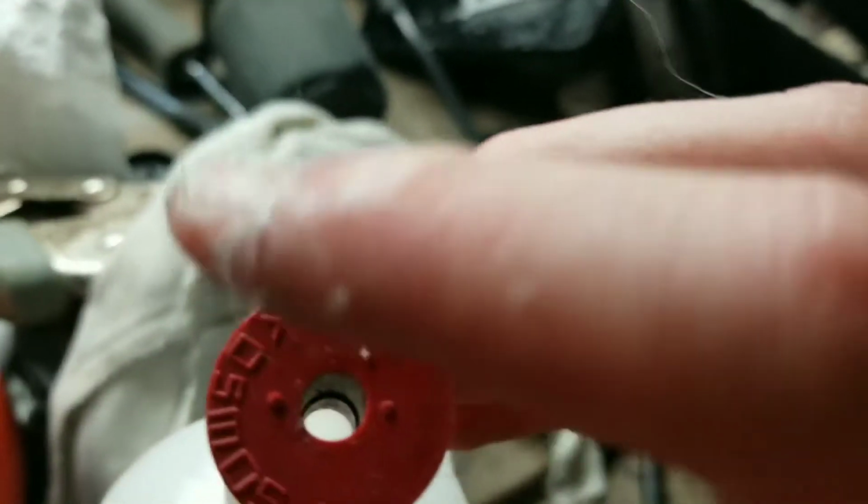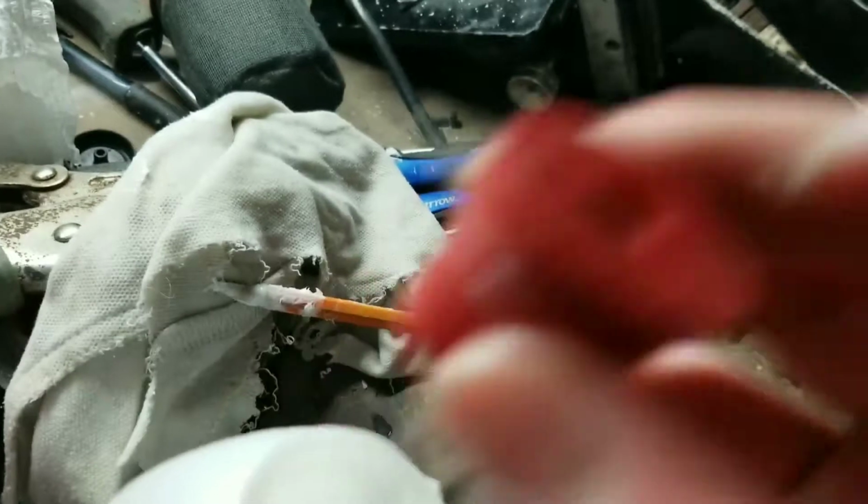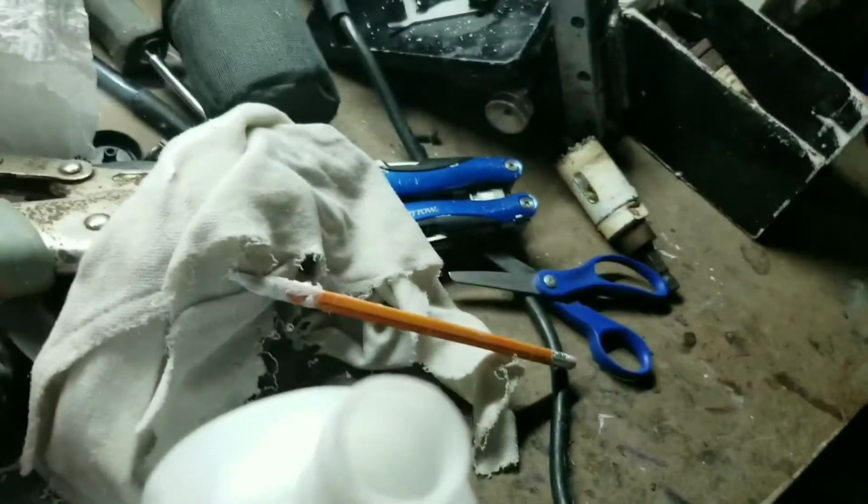I'm going to build some tops because I don't only want it to let out air, but it's also got to let a wire down in there to act as the electrodes. So yeah, let's do that.